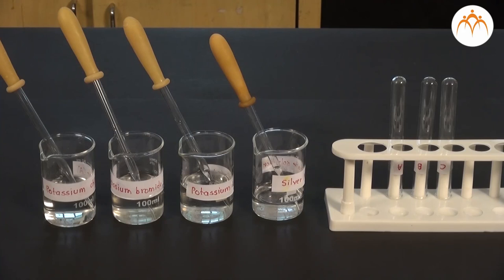For the experiment, normally we don't take them in powder form. We take their water solutions.